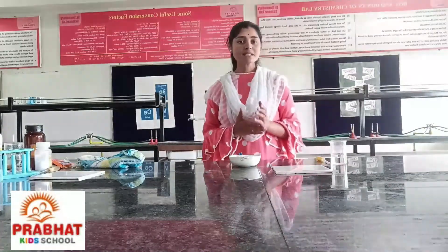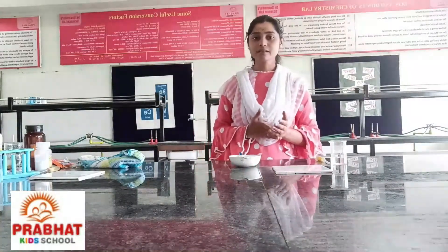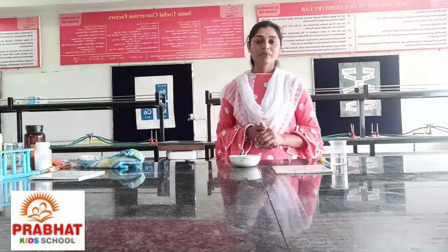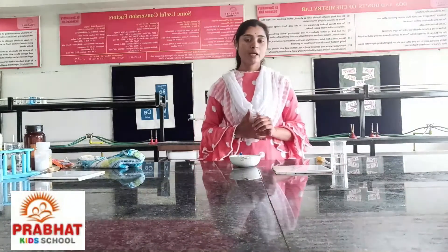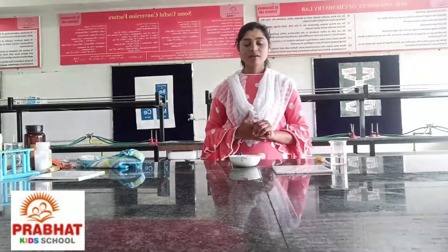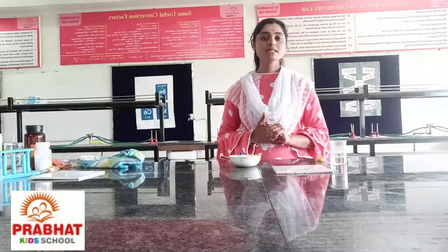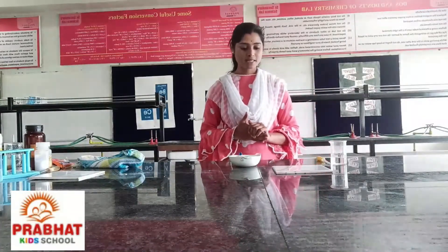Acid, bases, and salts — this topic you already studied in some previous days. Now, today we are going to conduct this experiment. The aim of this experiment is to determine whether the given sample is acid or base.